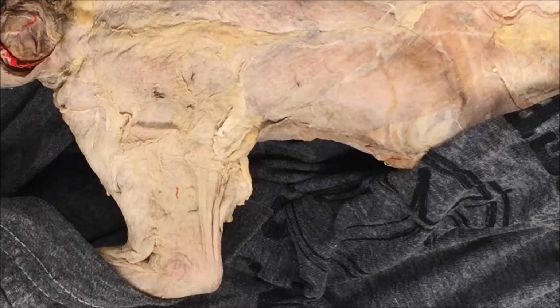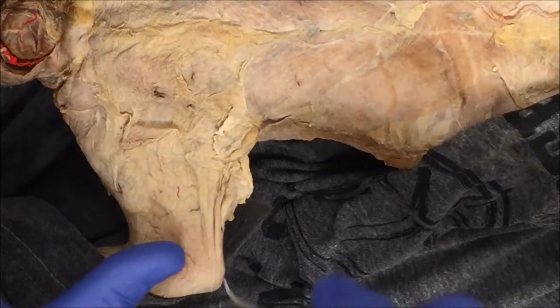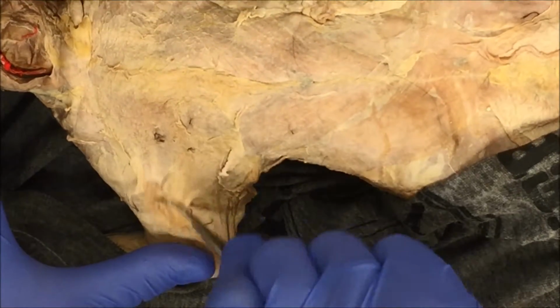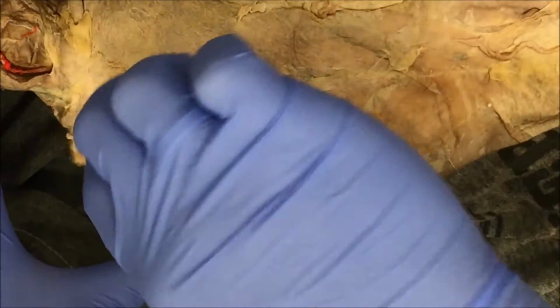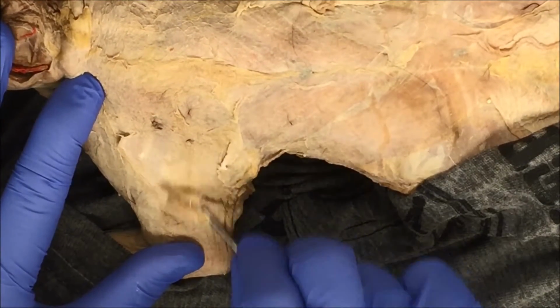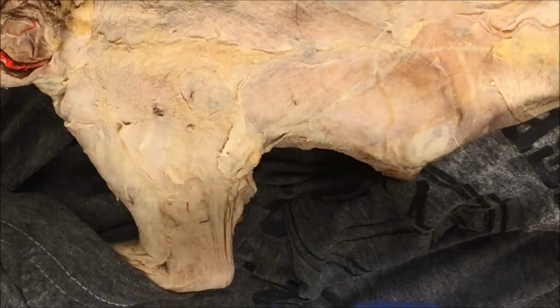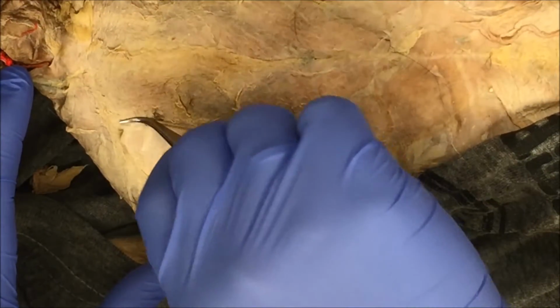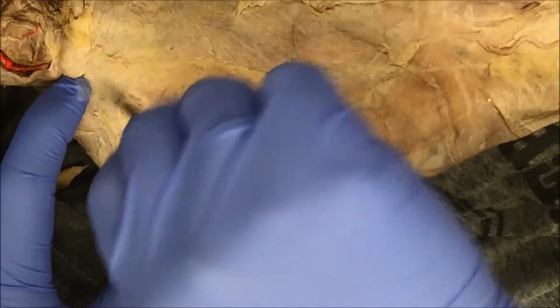In this video, we'll be dissecting the muscles of the chest. The muscles of the chest are, just like any other muscles that you've been dissecting, covered by connective tissue, and you're going to spend a little time removing this. Now, for the connective tissue, you probably want to use the curved end of your forceps, and then just pick and pull, almost in a scraping manner.